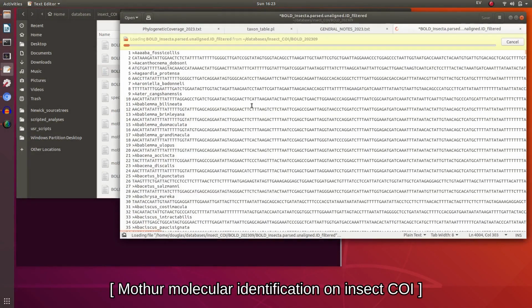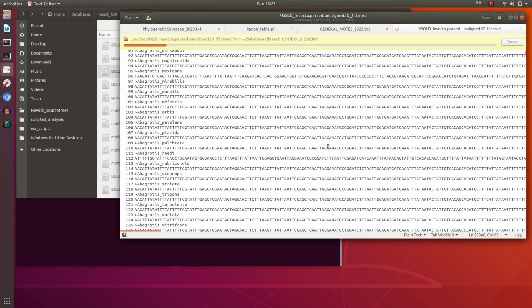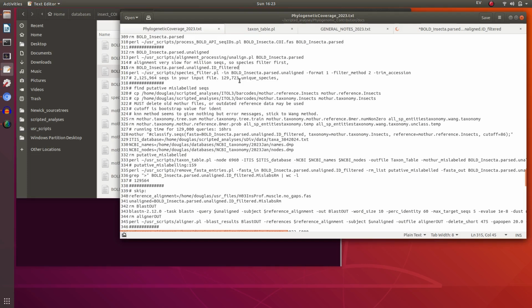We have here a COI database, unaligned. Now this is all from BOLD. 129,000 species in here.